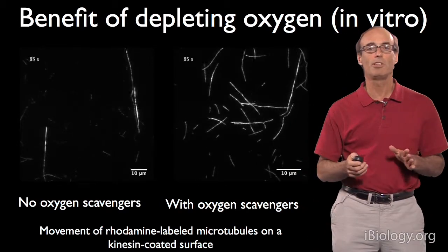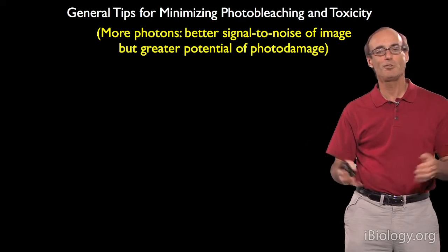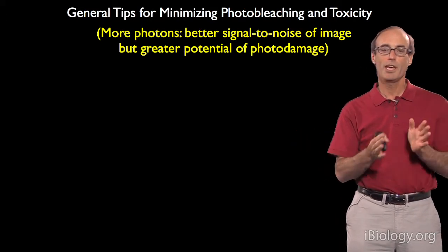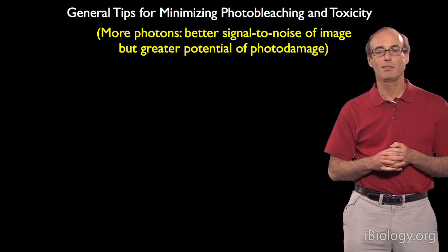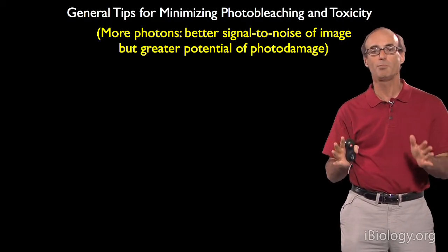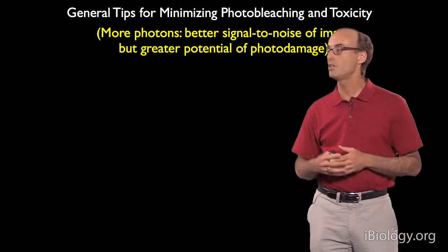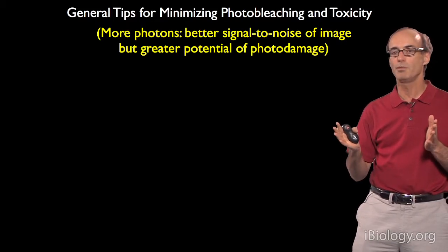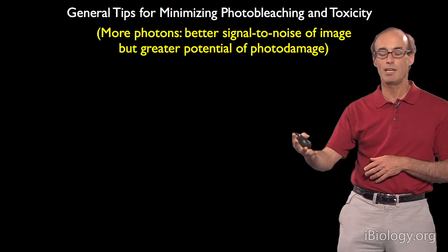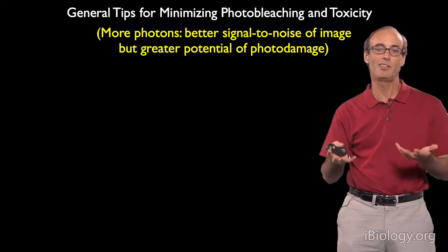When working with living cells or tissues, we can't remove molecular oxygen, so we need other strategies for minimizing photobleaching and phototoxicity. The basic strategy is to minimize light exposure on the specimen. There is a trade-off: the more photons we use, the more fluorescence is produced and the better the signal-to-noise. But over-illuminating risks creating more photo damage, which can actually interfere with the cellular processes we're trying to observe.